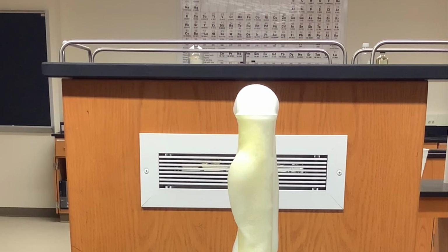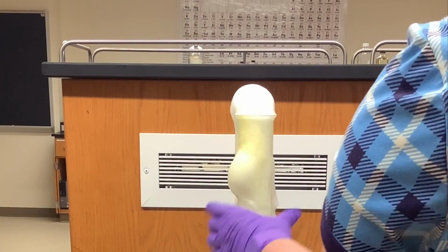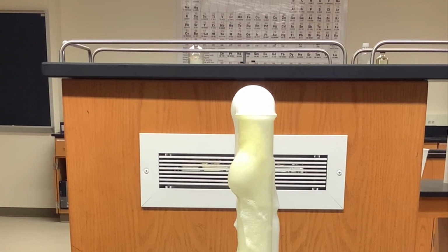So the reaction is forming oxygen gas. We verified that with our flame test. And it is producing water, which we can see is exothermic, and I can feel it when I touch the reaction. It's very warm to the touch. So I know that this reaction is exothermic. It's giving off heat as a product.